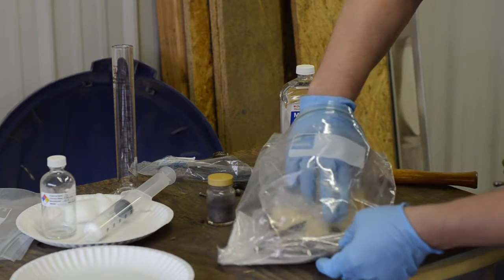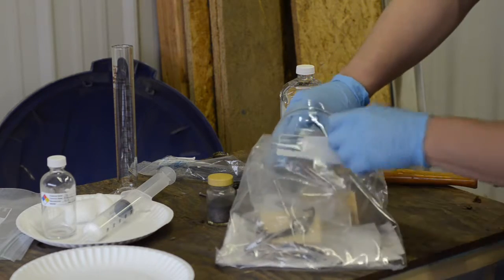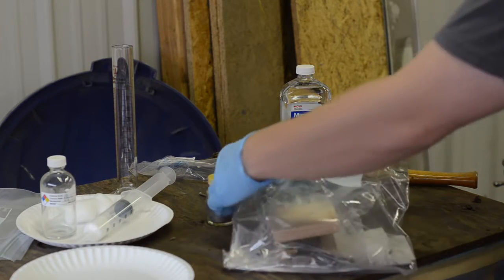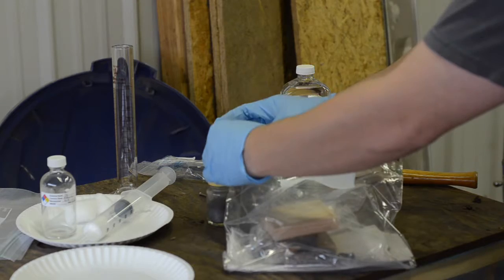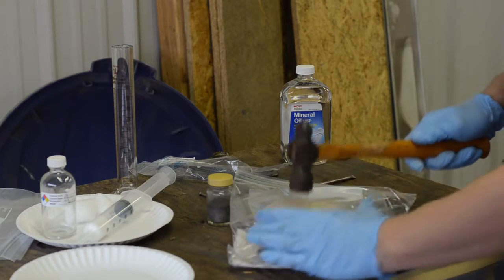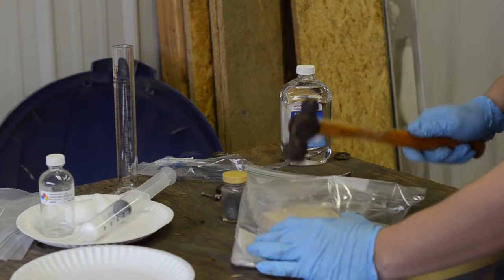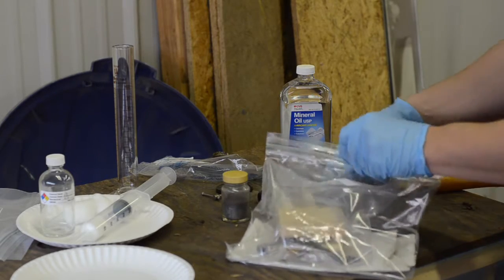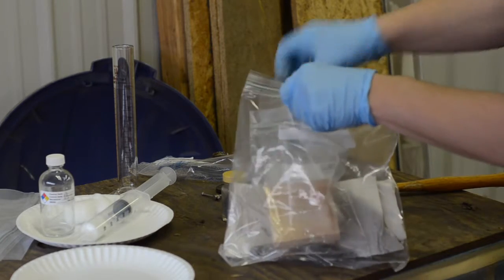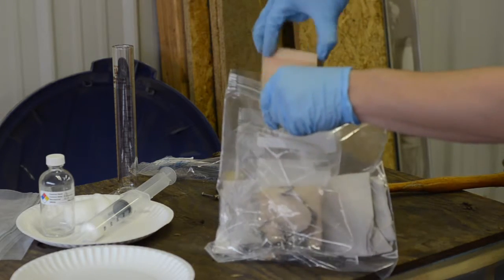And then we will get this next one staged. This block up, seal the bags, check that real quick, looks good. Number two. That got it. Let gravity help us out again. Looks good.